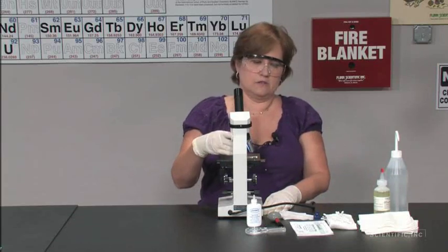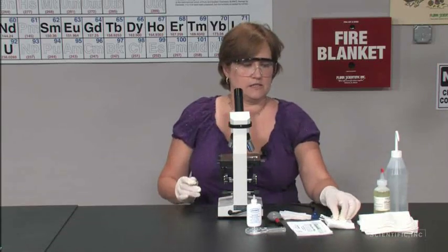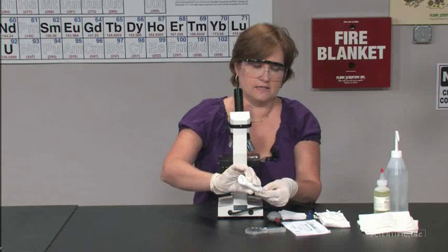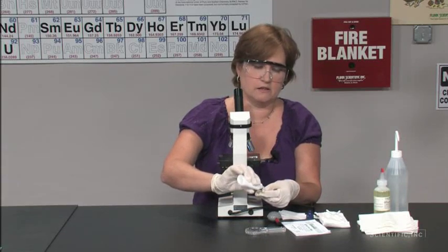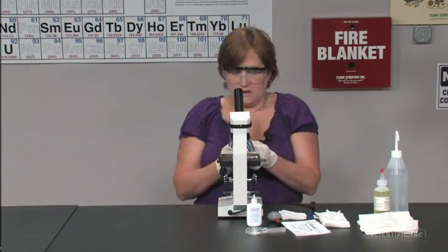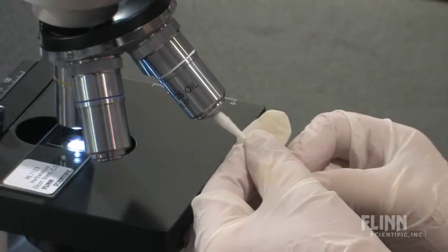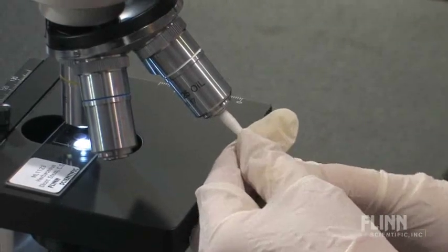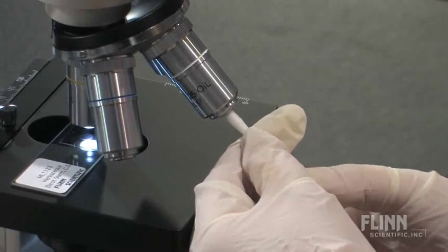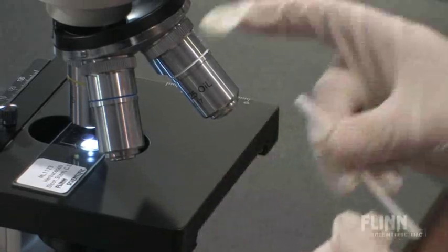Rotating it out. With this, you may need to use more than just lens cleaning solution. And you'll notice I'm using a cotton swab because I can get into the nooks and crannies. Hold, gently rotate, and then dry.